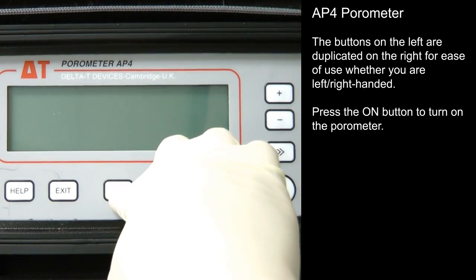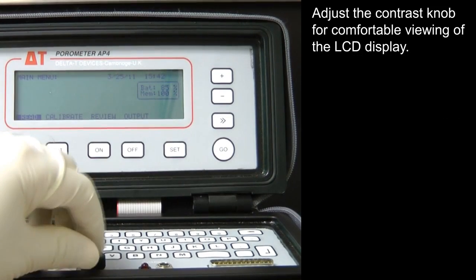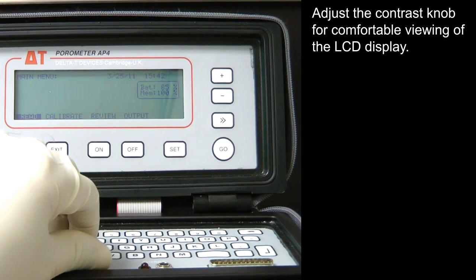Press the on button to turn on the Porometer. Adjust the contrast knob for comfortable viewing of the LCD display.